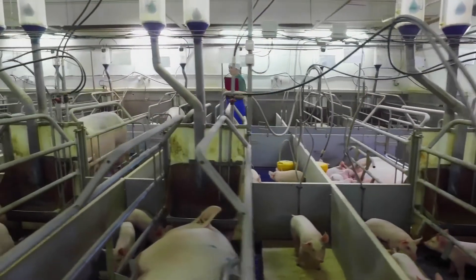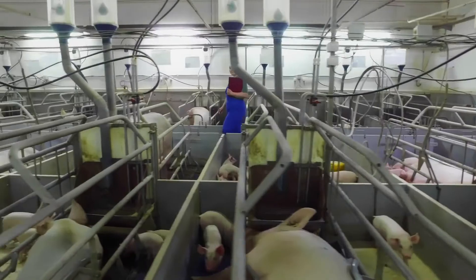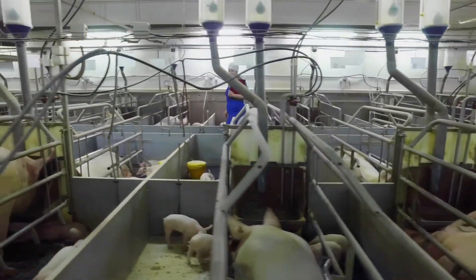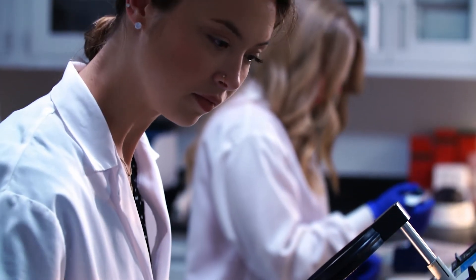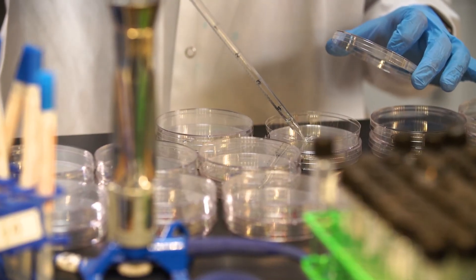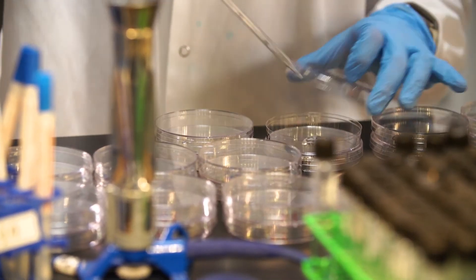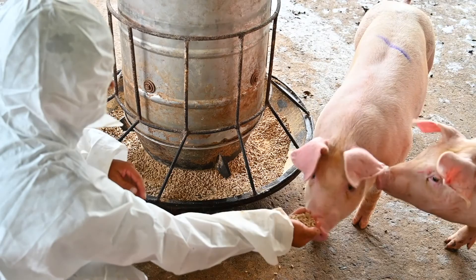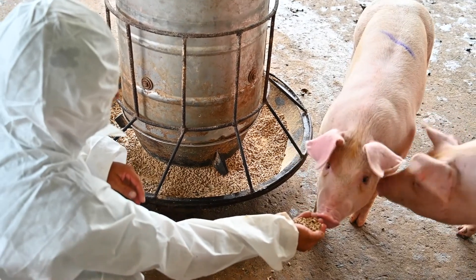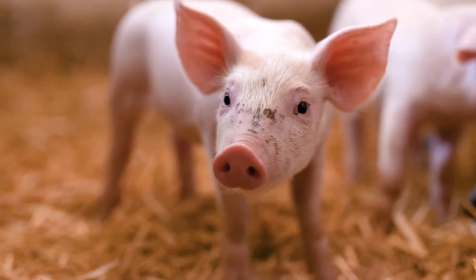In addition to the microbial terroir process, our lab also uses microbiological, molecular, and immunological methods to investigate other diseases facing today's swine operations, to help them address ever-changing on-farm challenges. Our goal remains constant: to better serve pork producers by understanding important intestinal swine pathogens and identifying new, more effective ways to invest in swine health and productivity, drawing from our collection of nearly 60,000 potential probiotic strains.